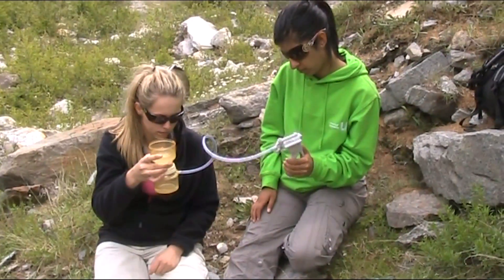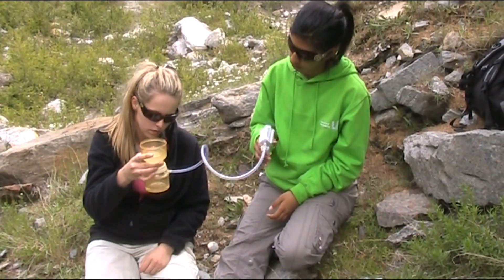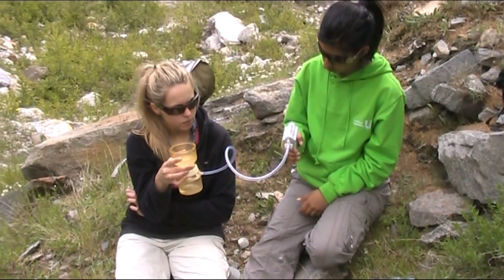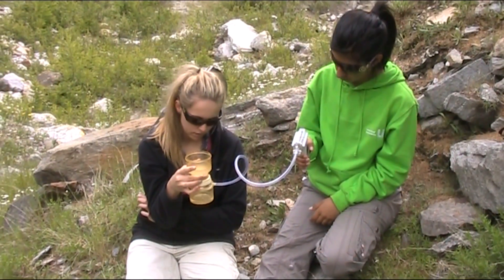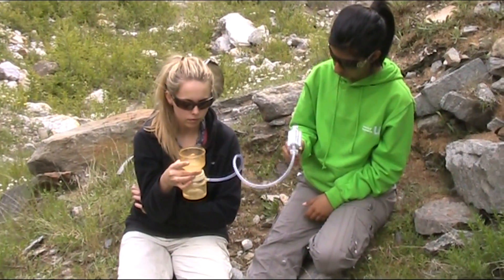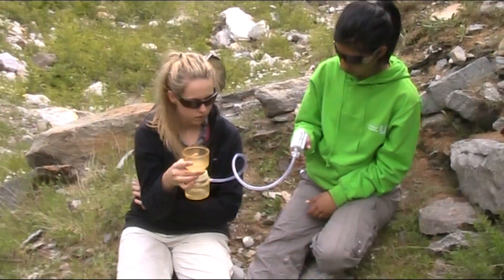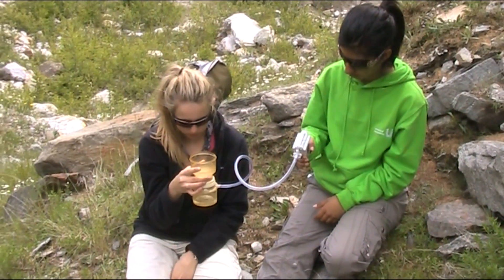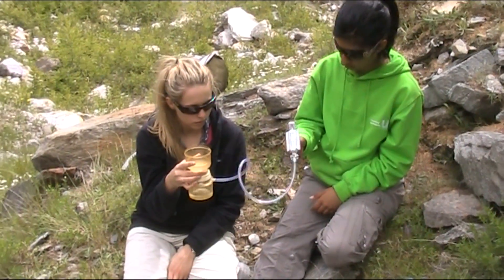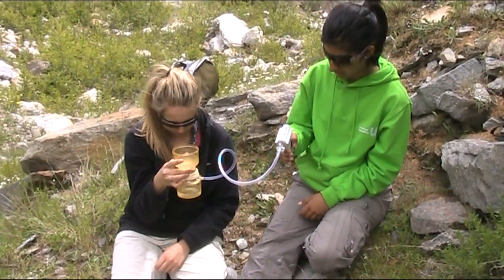You will find that the rate of water throughflow drops as you filter. That's because sediment clogs up the filter paper and blocks the pores, so it does get slower. Obviously the higher the sediment load, the worse that problem is, so a good deal of patience may be needed. You don't need to pump continuously once the vacuum is strong enough — you can relax and just add a few pumps every few seconds to keep the vacuum pressure high enough to keep the water flowing through.